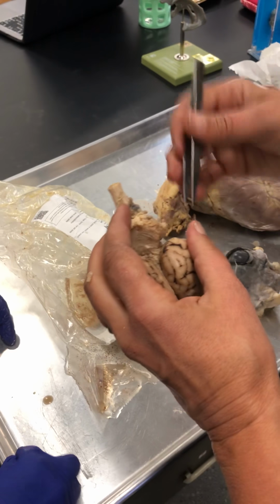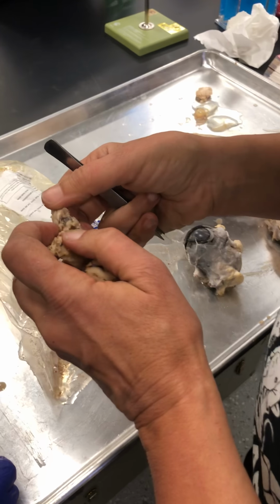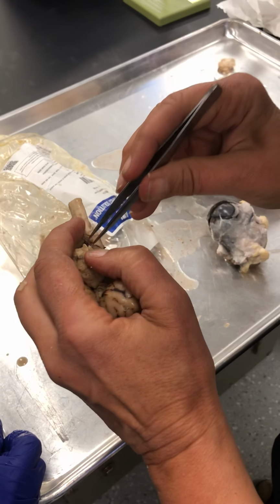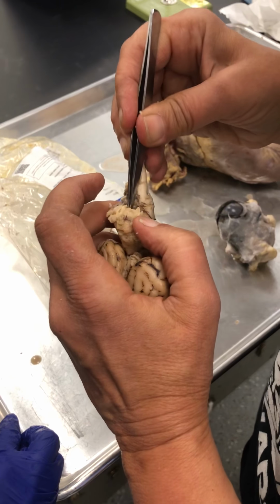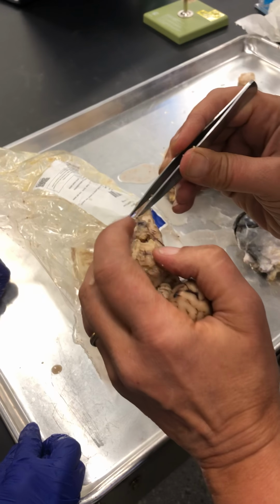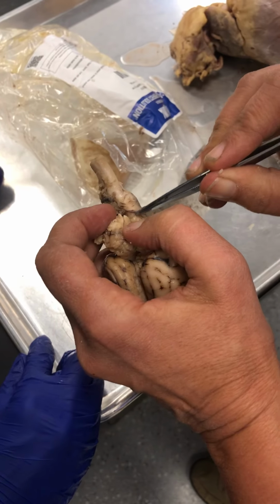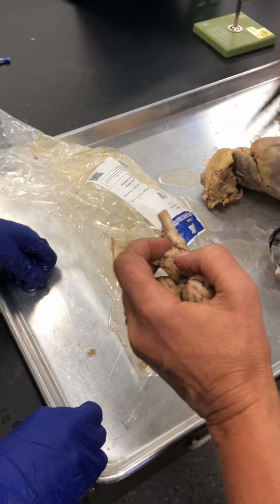You can't see the other fibers because you'd have to cut through the pons. And then back here, if we pull the cerebellum up a little bit, we should be able to see, first of all, this would have been the median aperture. The lateral aperture, you can't tell them apart because the membrane has been broken in order to see things, but you should be able to see, there we go, this little rod right here, this stalk? That's the inferior cerebellar peduncle. Those are the three legs of the table.